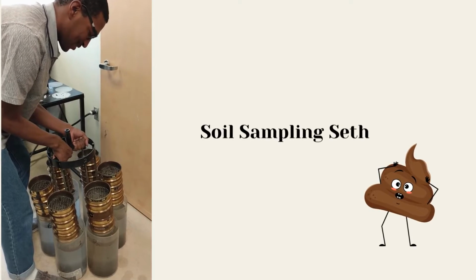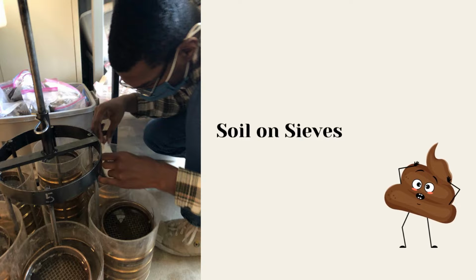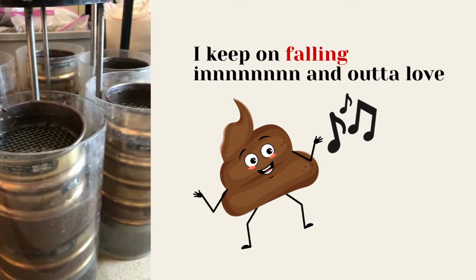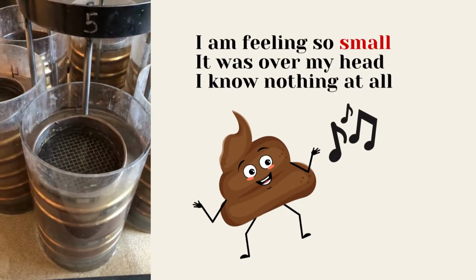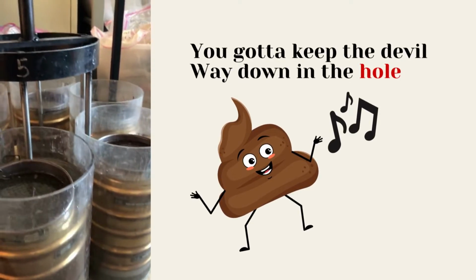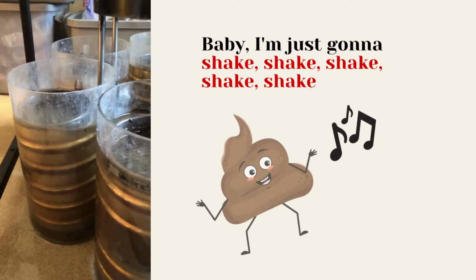Today we're going to watch Seth. What he's going to do is take some of the soil samples that we've collected and put them on the very top of a set of sieves. That means that as soil falls through the sieves, with progressively smaller and smaller openings, wherever those pieces get stuck, they weren't able to fit through, so they must be at least slightly bigger than the holes. So he's going to put this stack of sieves inside a water tank, and on top of that we'll put our soil samples, and then we'll start the shaking and the sieving.